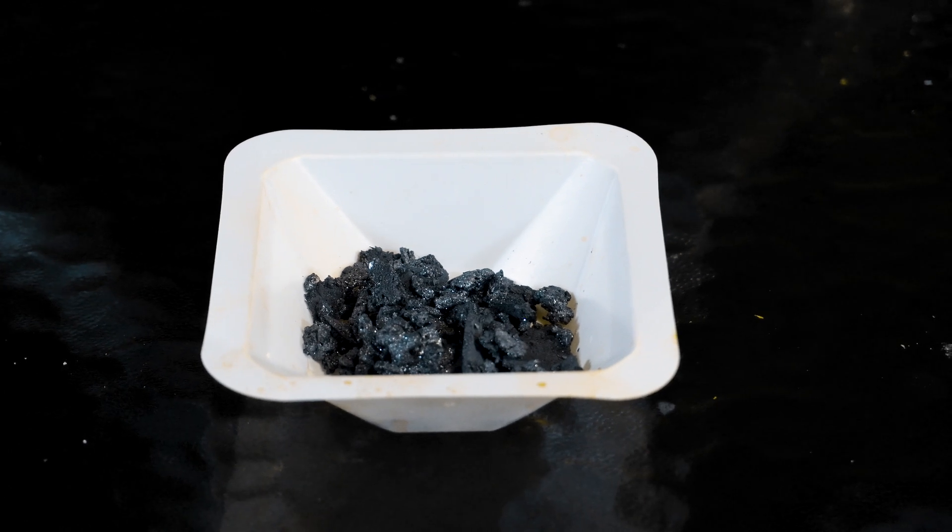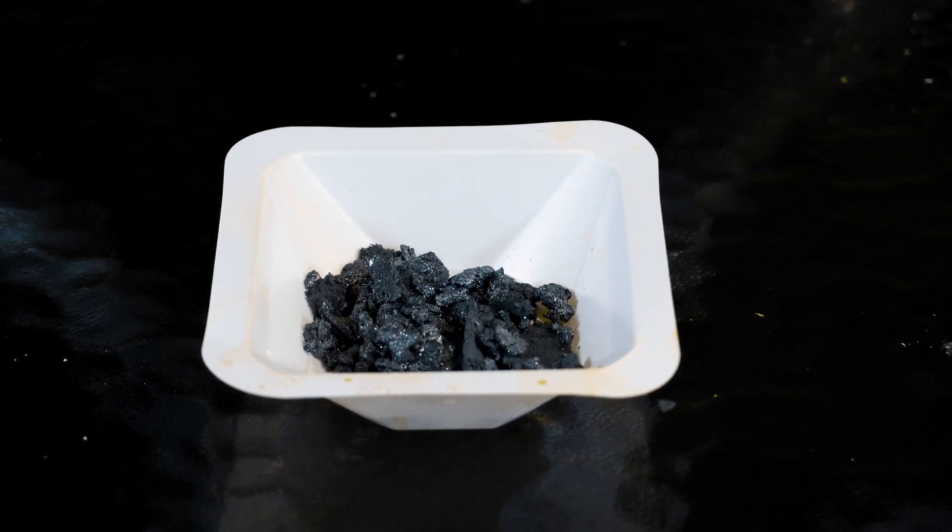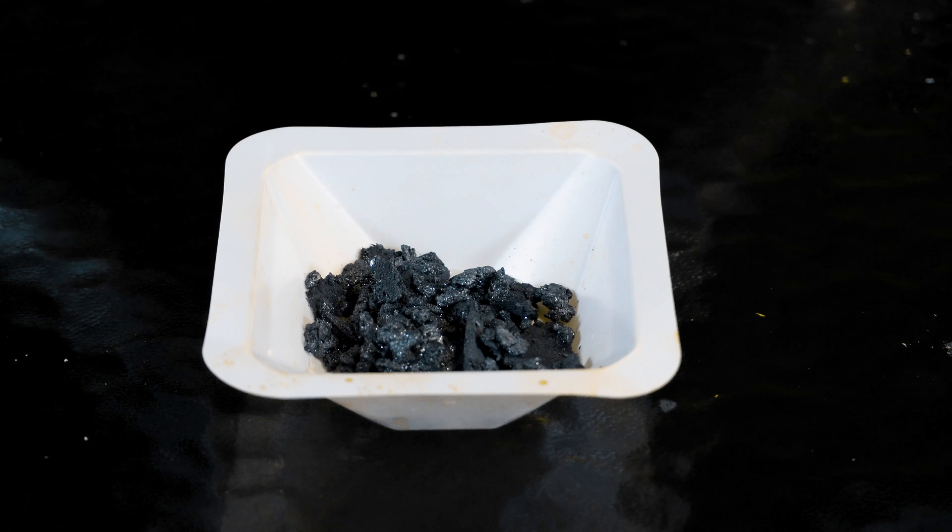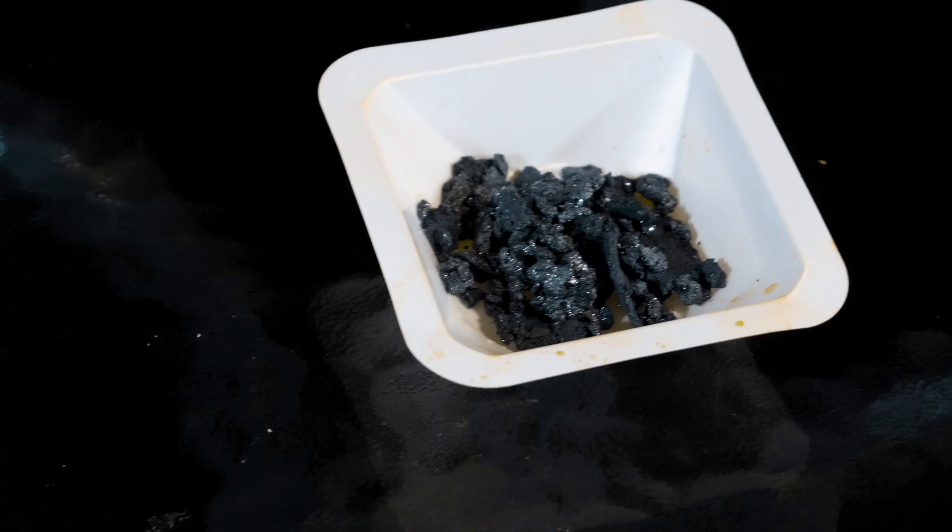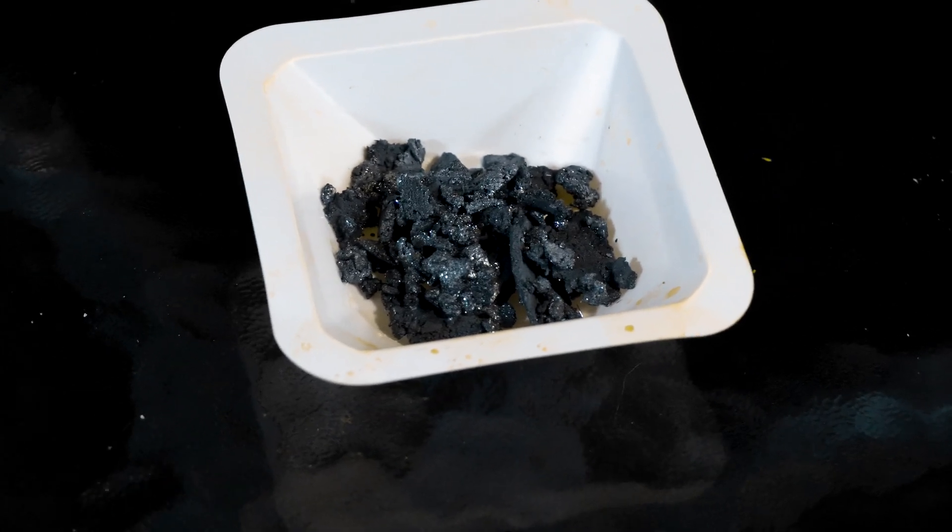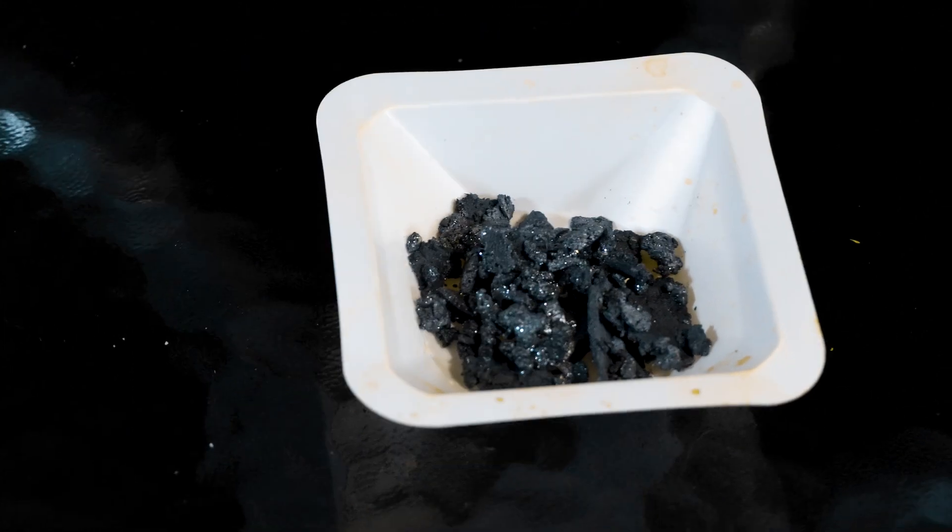And there it is, some pretty good looking iodine. This can be used for a number of fun reactions including the aluminum plus iodine purple smoke reaction, but I'll be primarily using it as a TLC stain.